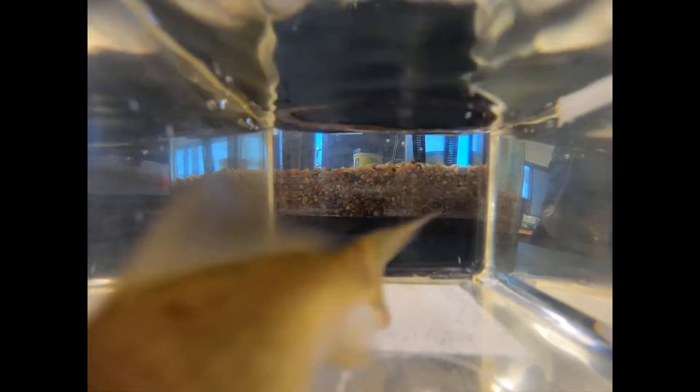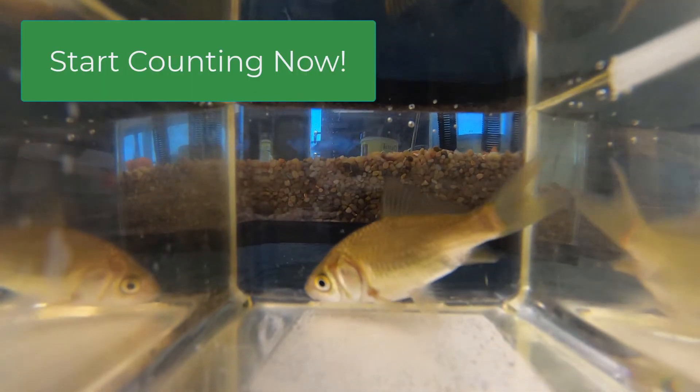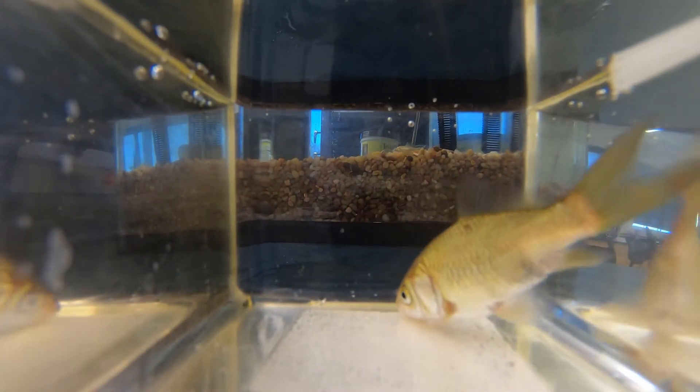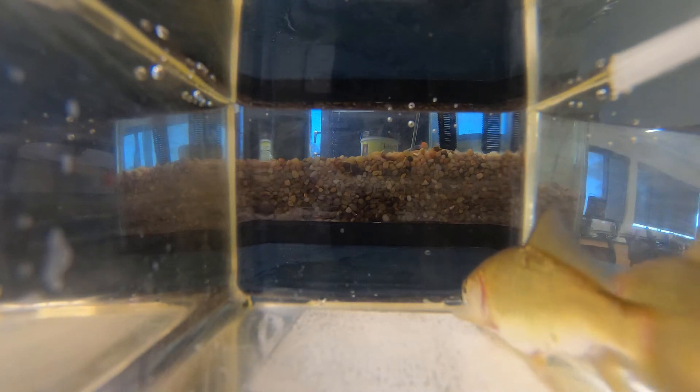We're going to set this up by filling a container with water and then getting a goldfish from our aquarium and placing it inside. When I tell you to do so, you're going to want to start counting operculum movements. Start now.